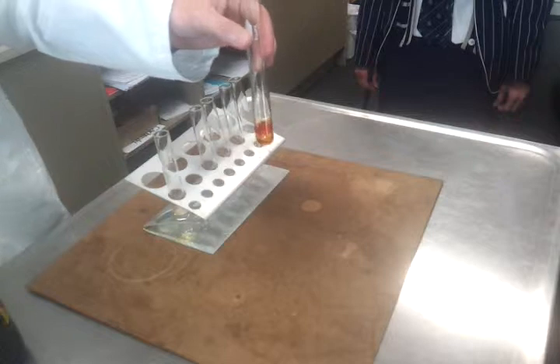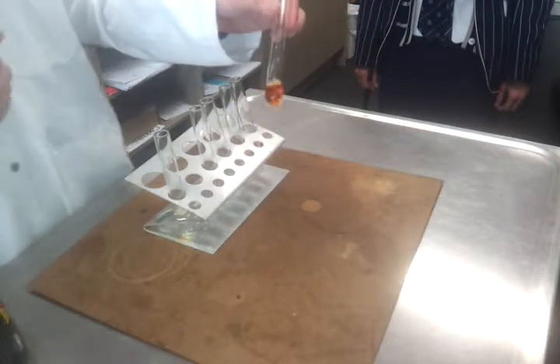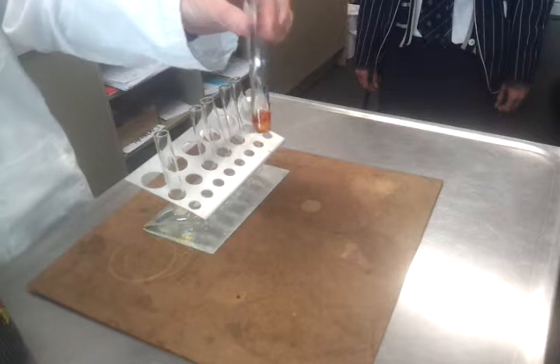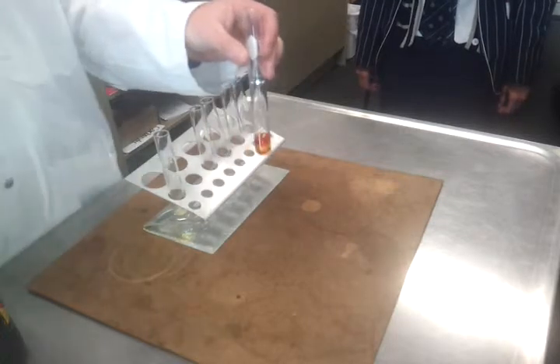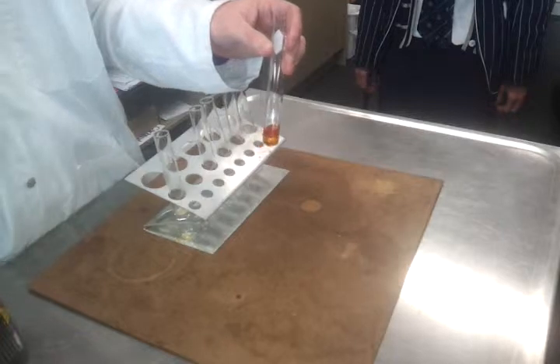Now, if I give that enough natural light, so the ultraviolet wavelength of light, eventually it'll react. But it doesn't happen in front of our eyes. So that's a really good test for alkanes, because alkenes don't do this, as we'll see in a future lesson. Alkenes have a different observation.